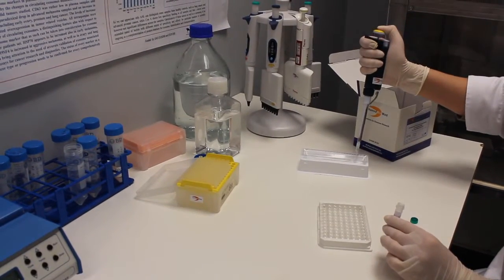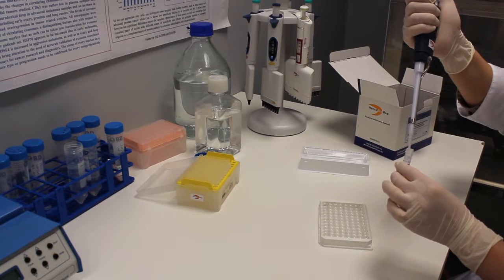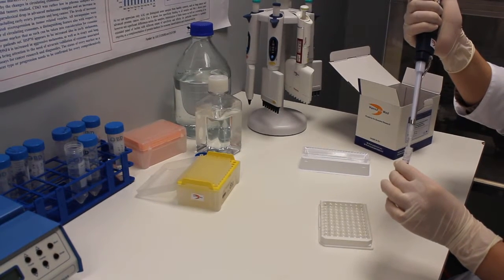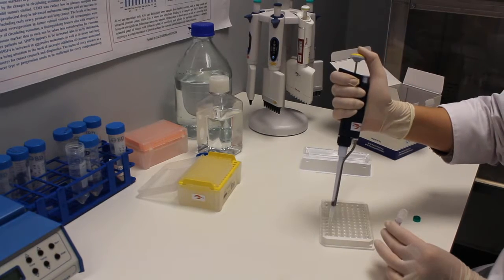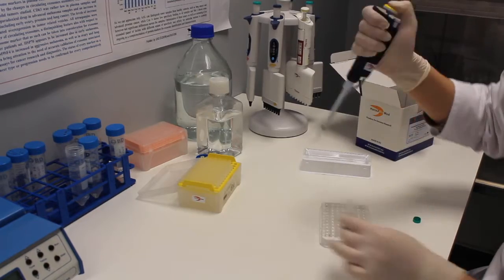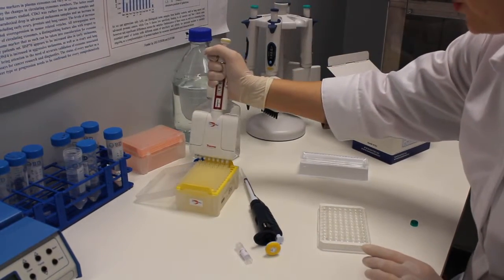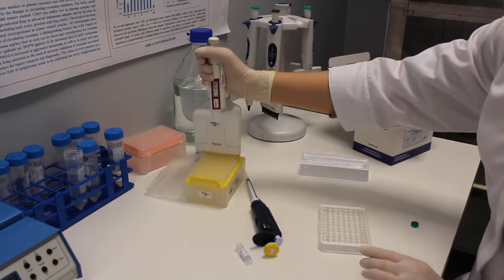Add 100 microliters of PBS to reach a final volume of 200 microliters. Add 200 microliters of exosomes into the first well. Then add 100 microliters of PBS in other several wells.